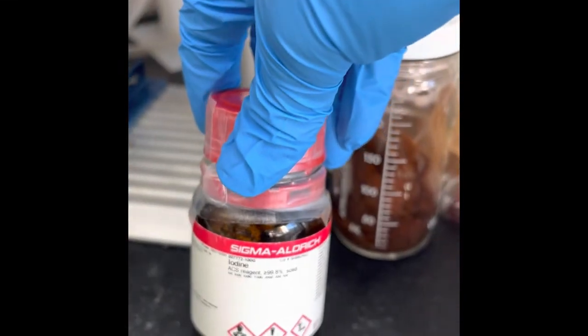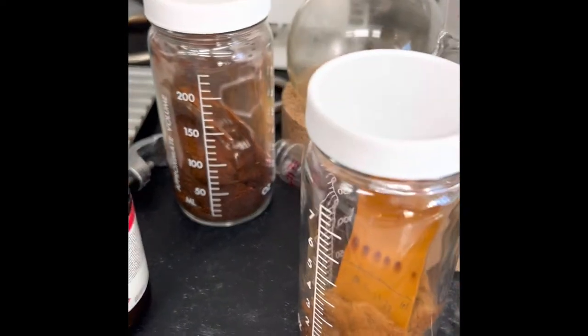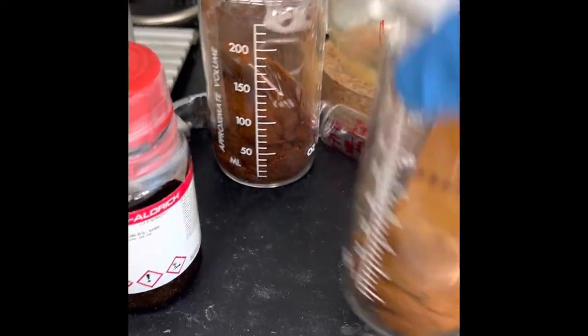Hello, this is about iodine. When the compound is not visible under UV light, you can use this iodine chamber.